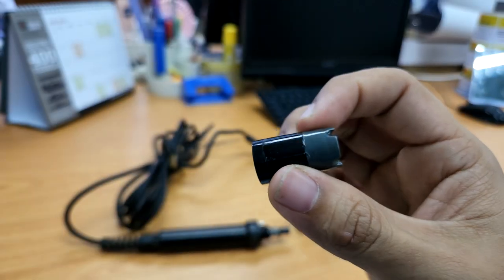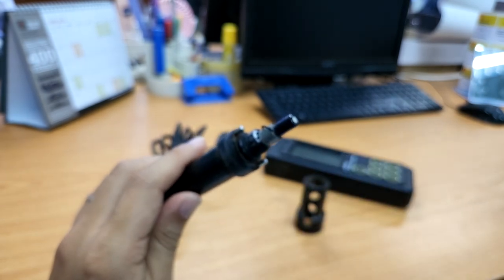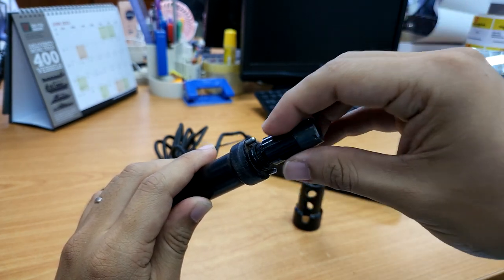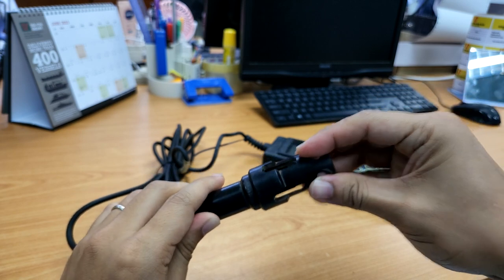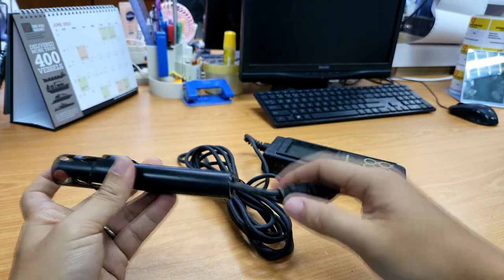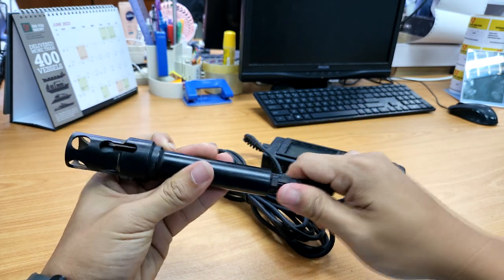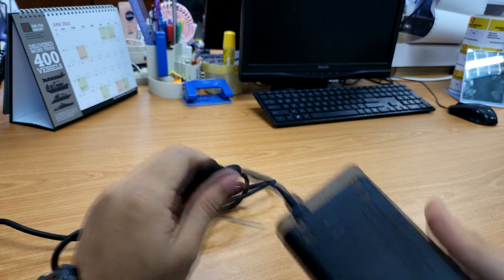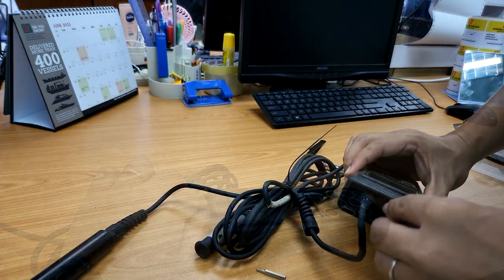This got me really puzzled because I have two pieces of equipment that are similar but have the same failure history — both having issues in the probe. For both models, the official advice was to change the probe, which is really weird considering the probability of two models failing in the same place. Here you can see the older model I already have on the farm — it has quite an old, worn-out membrane where the sensor measures dissolved oxygen. This is also where the linkage between the wires and the probe is. You can unscrew it, but there's actually no way to take out and check whether the wires are compromised, because I believe they have all the wiring in epoxy, so we can no longer open it up.